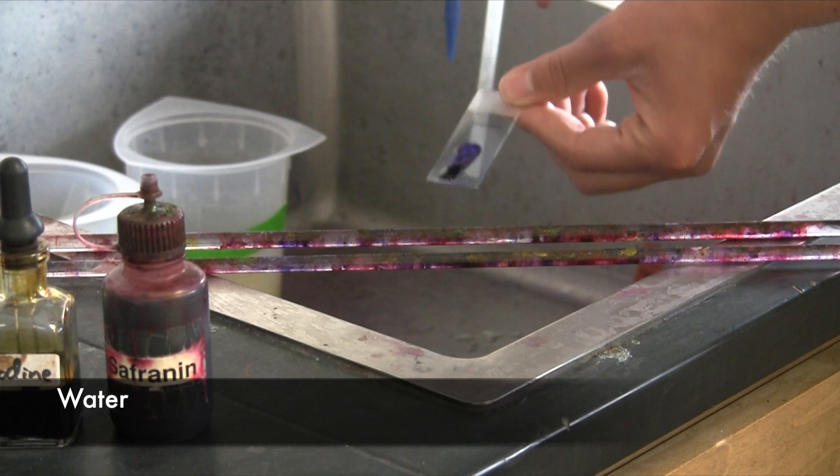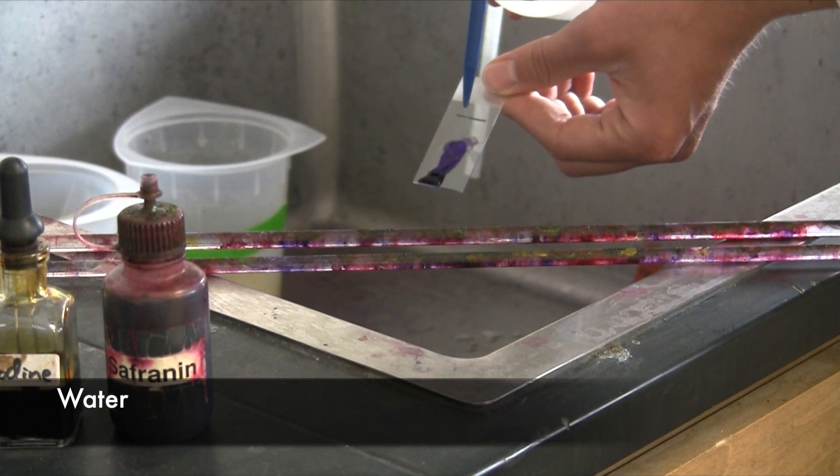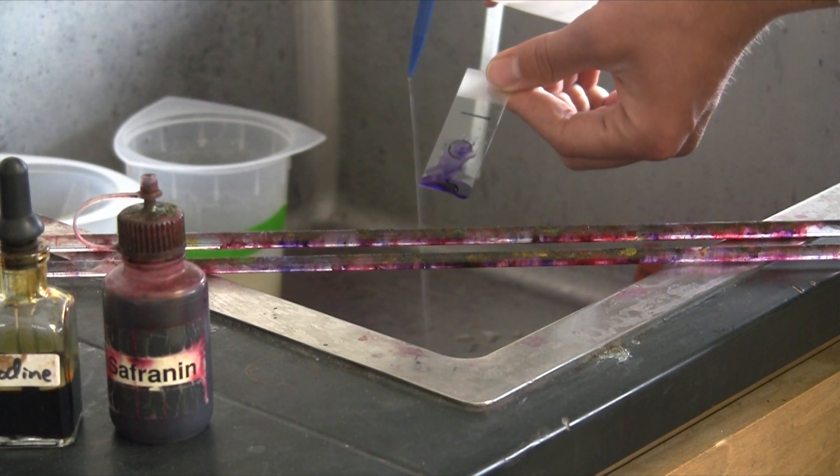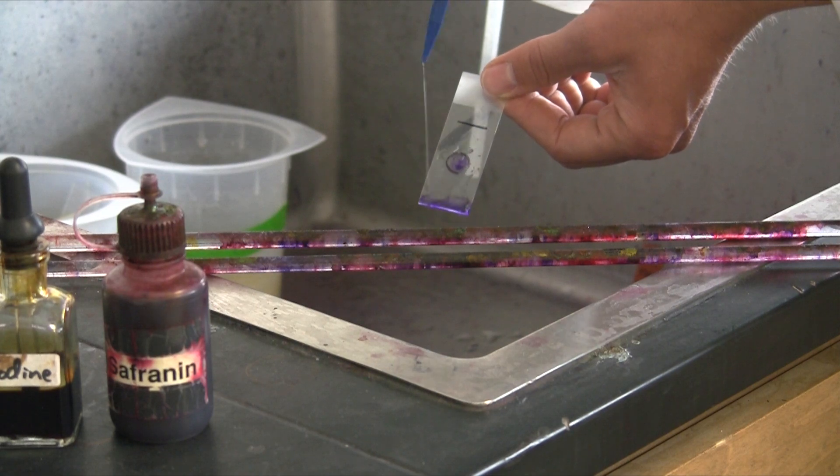Remember the mnemonic, come in and stain will help you remember the order. Water rinse is next. And just go ahead and rinse the crystal violet off.